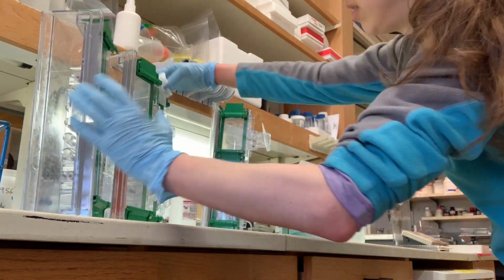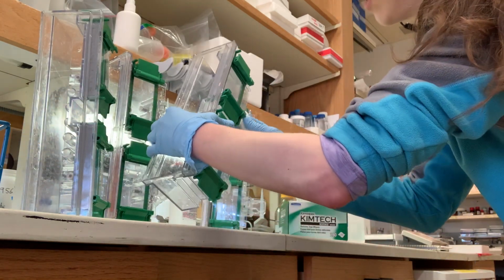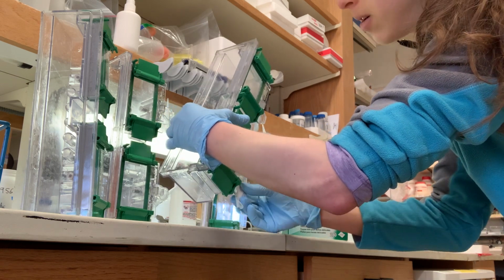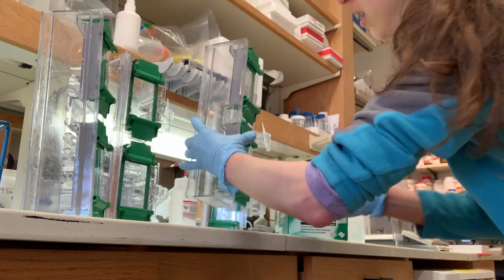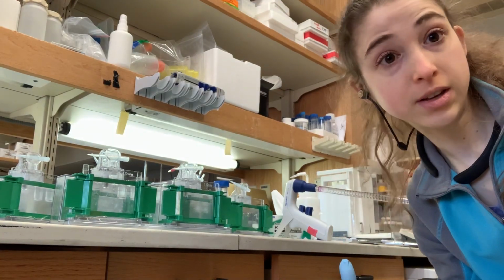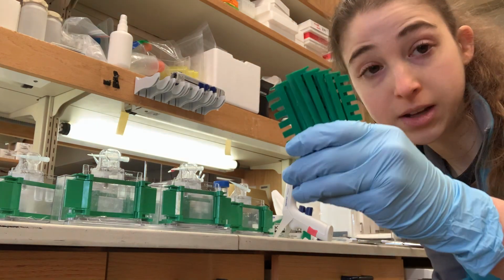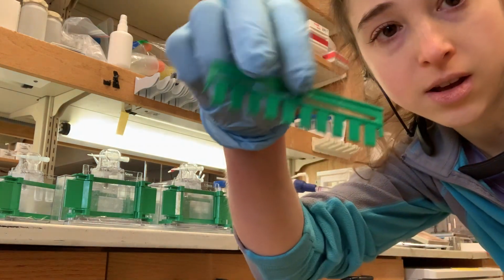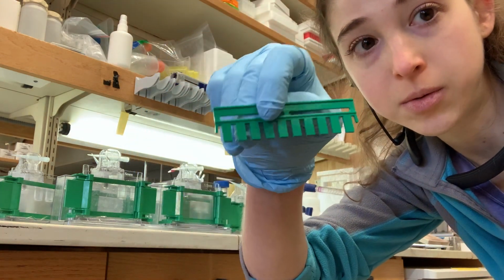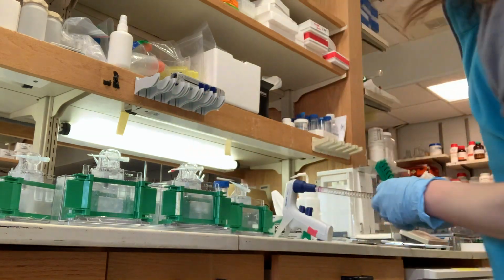And then I'm going to get my combs ready, so that I will have the combs ready to put in as soon as I add the stacking gel. So once again, I have everything ready to go before I get the polymerization going. And this time it includes combs. I'm making 10 well combs. Make sure your comb matches the thickness of your gel.